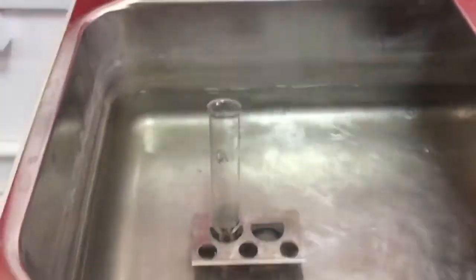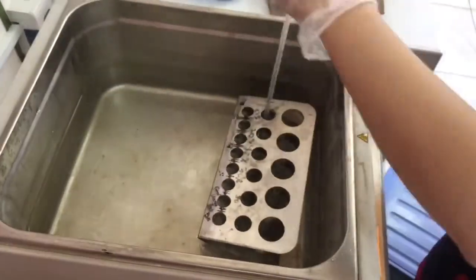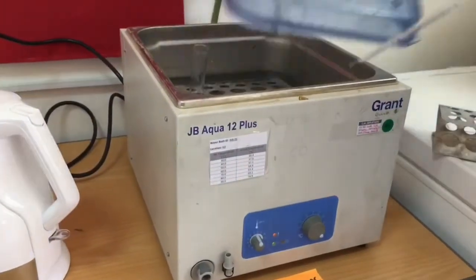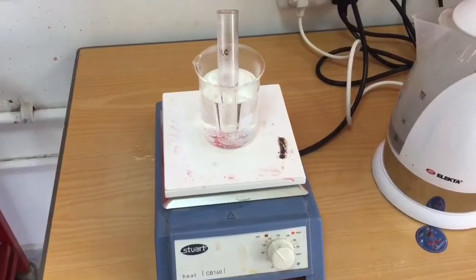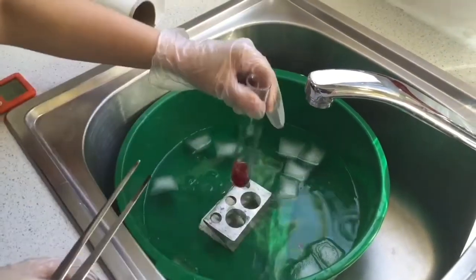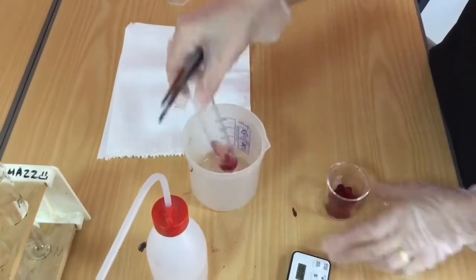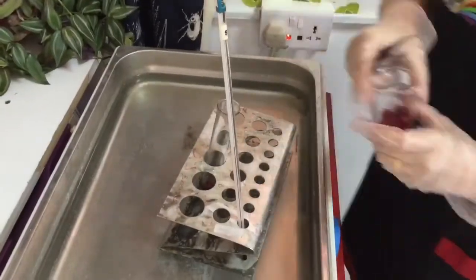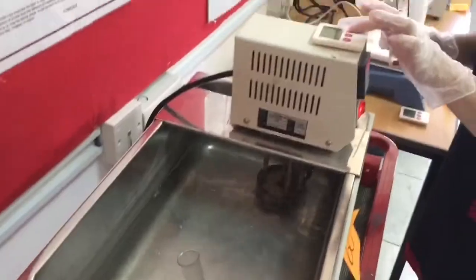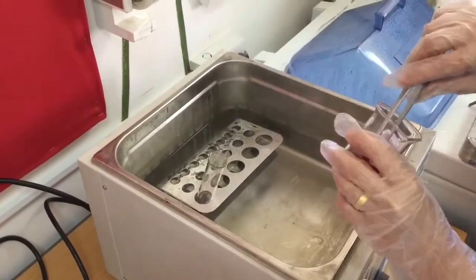Which are 0 degrees, which I'm creating in the bucket of ice, 20 degrees, which is my room temperature, 40 degrees, 60 degrees, 80 degrees, and then I'm going to try and use a hot plate to get a temperature as close to boiling as possible. The warmest temperature I can actually get is 85 degrees with that, so I'm going to plot that point too.